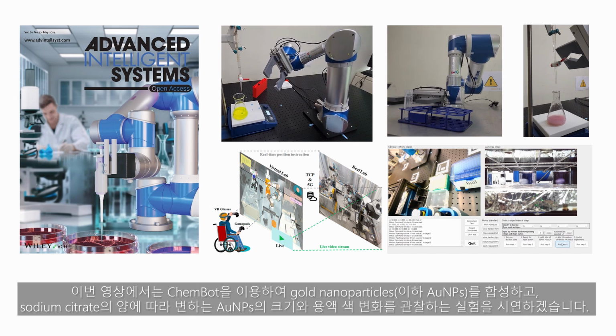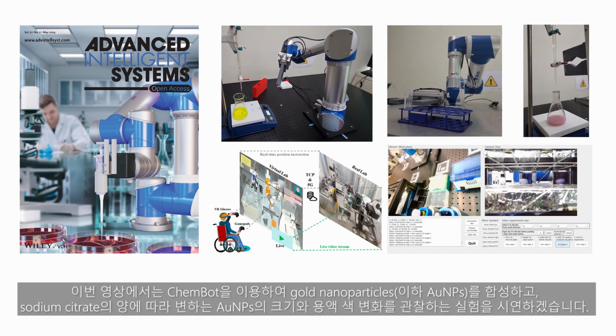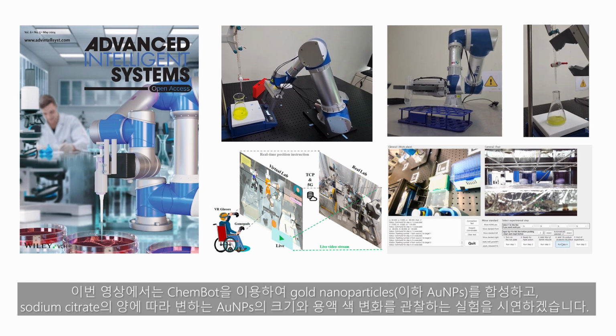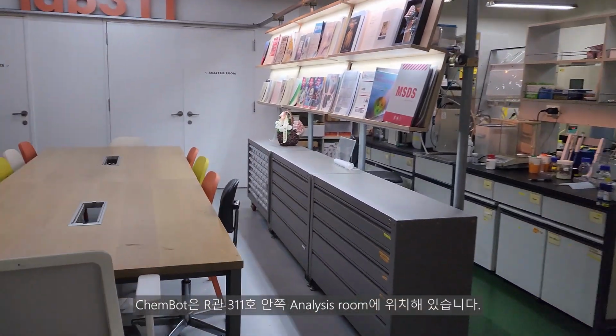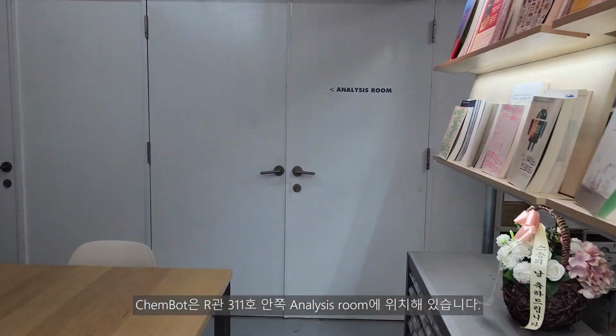In this video, we will demonstrate an experiment using ChemBot to synthesize gold nanoparticles and observe the changes in their size and the color of the solution depending on the amount of sodium citrate. ChemBot is located in the analysis room of R311.